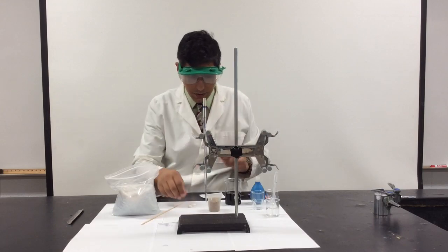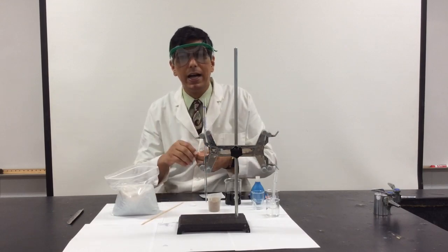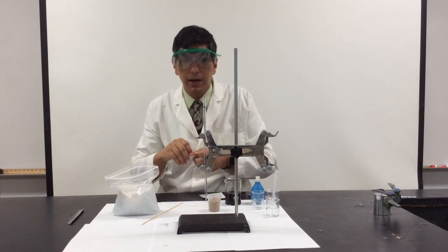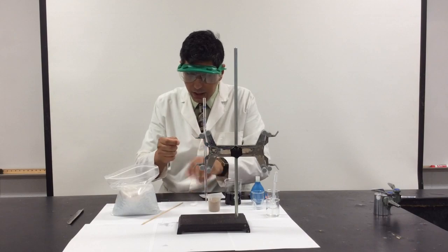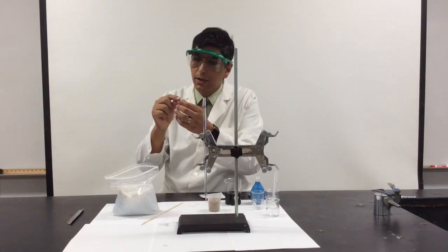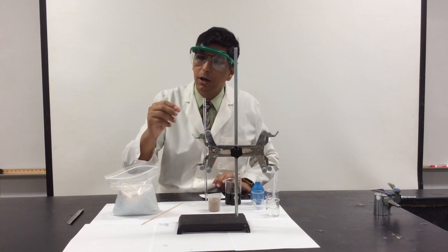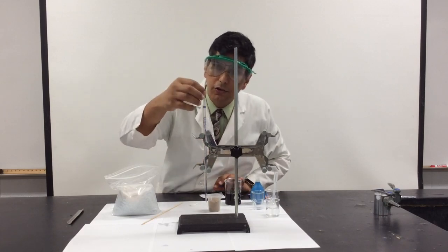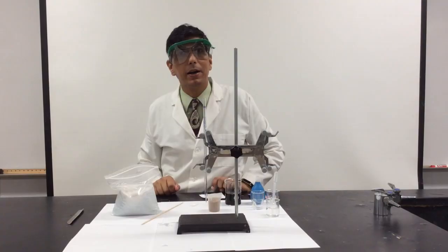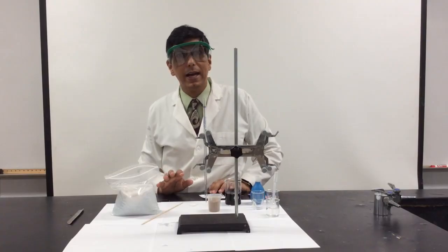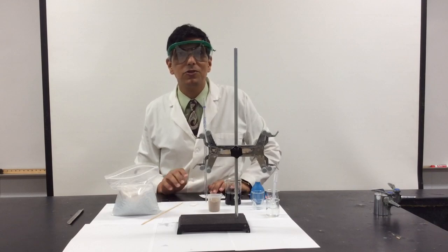And so the first thing I want to do is put a very small piece of cotton in the very bottom of that pipette. I have a very small piece of cotton, almost too small to see here on the camera. I'm going to wad this up into a little ball and just drop it into the top and it will fall down to the bottom of the pipette. That's going to act as a little secondary filtration system.